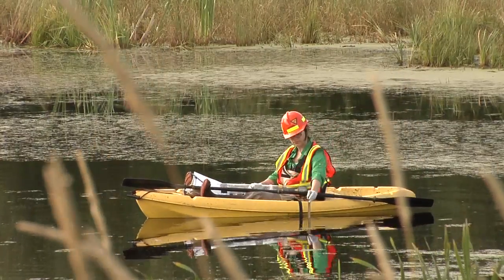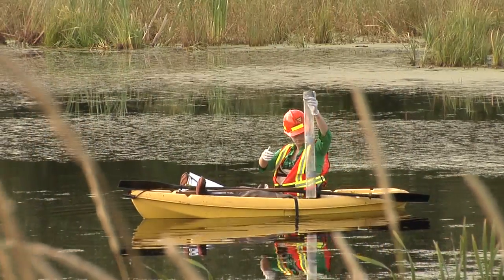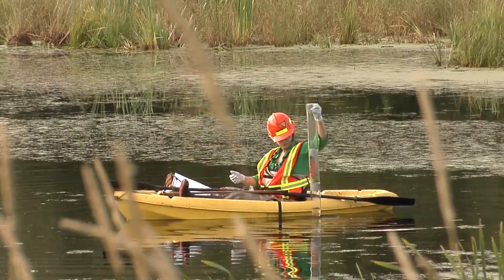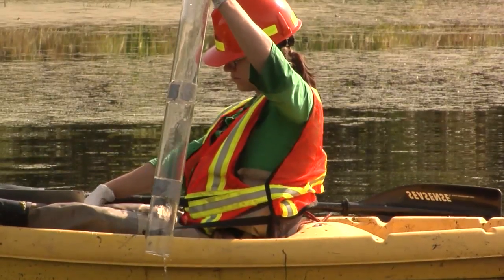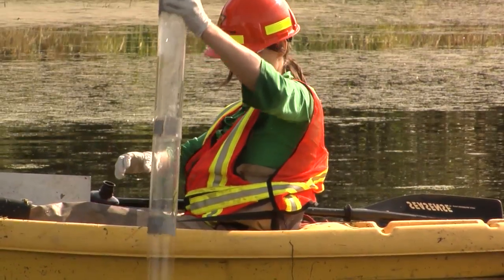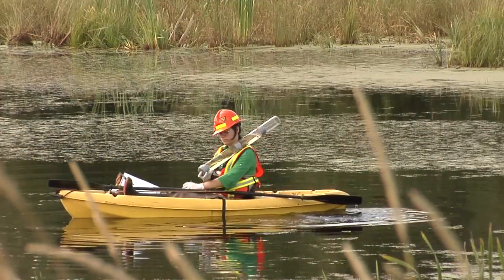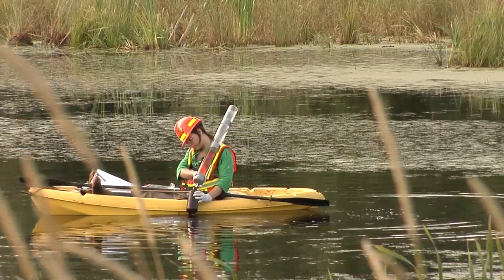Be sure the water column is sampled without disturbing the sediment bottom with the sampler. Then rinse the water sampler by lowering it 3 times into the water column. Submerge the sampler 1 more time and plug the hole at the top with your finger. Lift it out of the water as you invert it. Release your finger and empty the water sample into the labeled sample bottle.